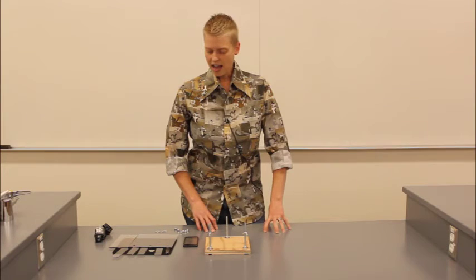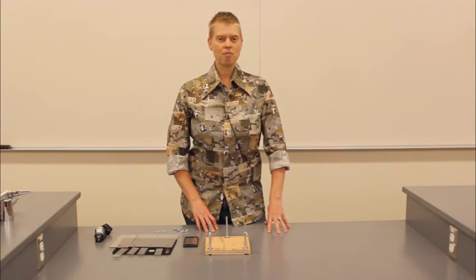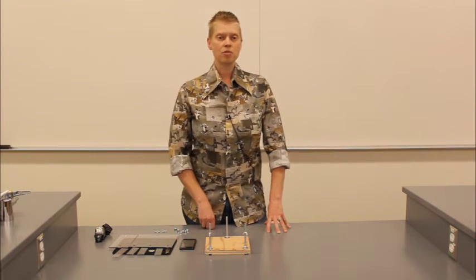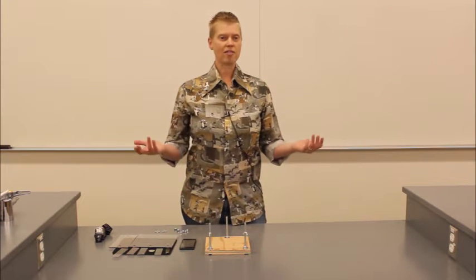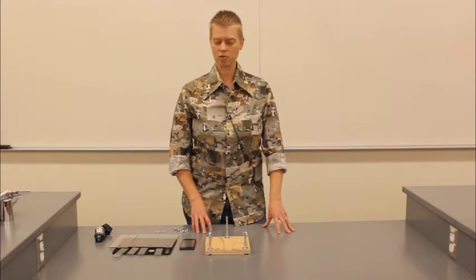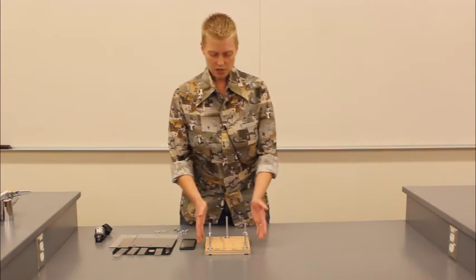So what we're going to do today is build a simple homemade microscope that you can use with your cell phone to get items from your house or from outside and look at stuff, examine it, observe it, and learn more about the world around you. So it's a pretty simple setup.